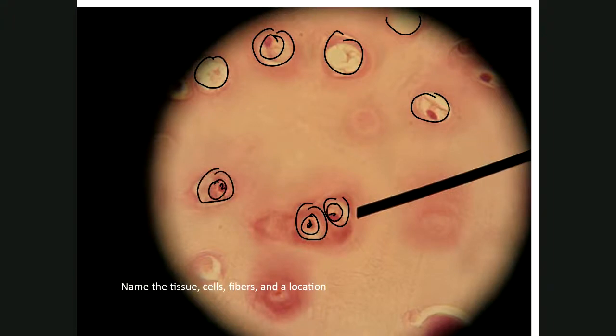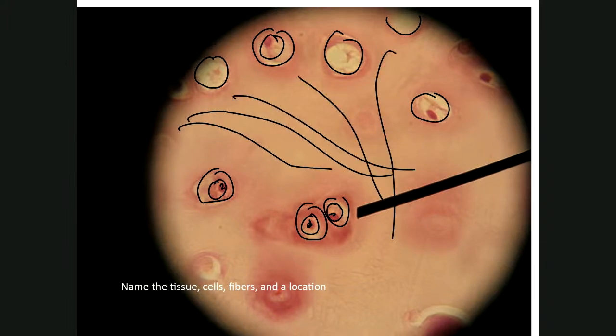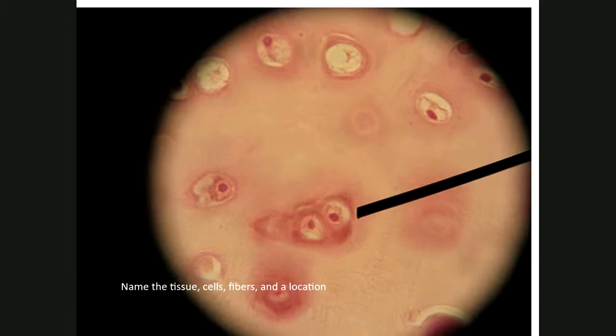So now we have 3 possibilities: hyaline cartilage, fibrocartilage, and elastic cartilage. This is not elastic cartilage, otherwise we would be seeing fibers crisscrossing the matrix. As a matter of fact, what we see here is a smooth matrix. A smooth matrix tells you this is hyaline cartilage. So this is hyaline cartilage. You should know the locations: articular cartilage, respiratory cartilage, costal cartilage, nasal cartilage. The cells are called chondrocytes. It is avascular tissue, and it has lacunae. And the function is to resist compression.